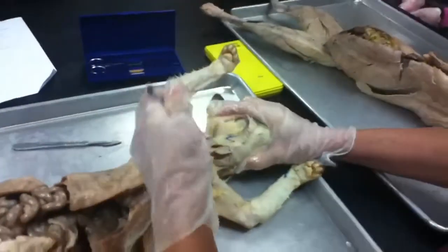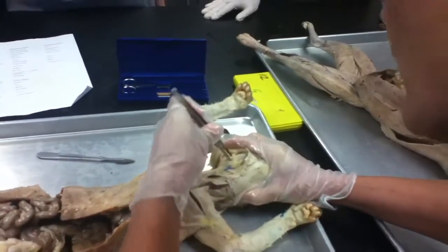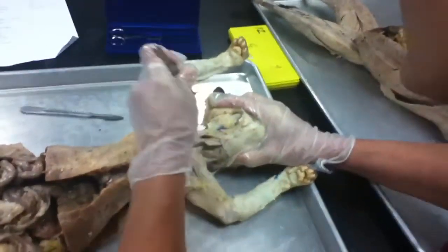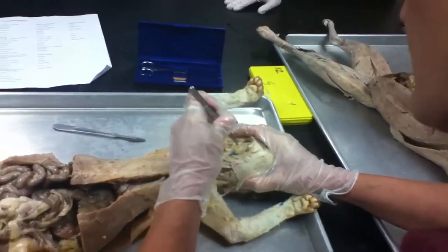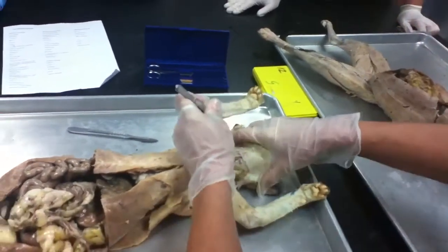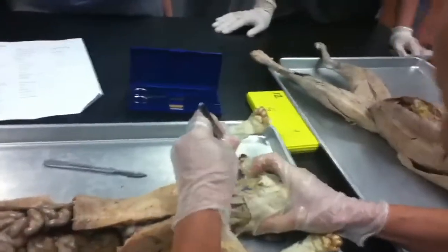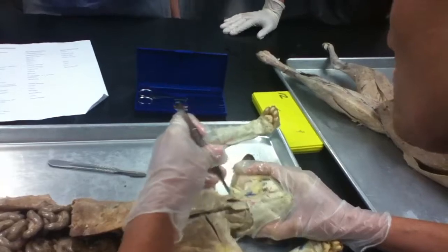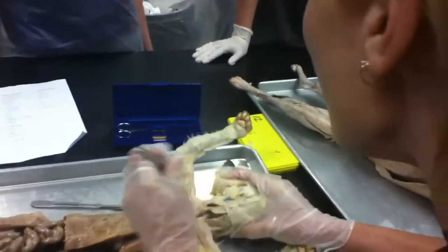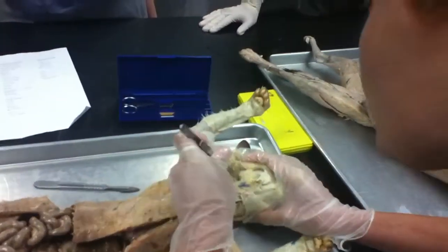3 salivary glands, just like humans have. As you kind of pull away at this connective tissue here, you're going to notice that glands throughout the entire body tends to look like pork that's kind of been chewed up and then wadded back together again, just like how we had the fajita meat down there, okay? So up here in the face, the parotid glands look kind of similar in terms of it being kind of chewed up meat looking, okay? So here is actually the beginning of the parotid gland, this portion in here.